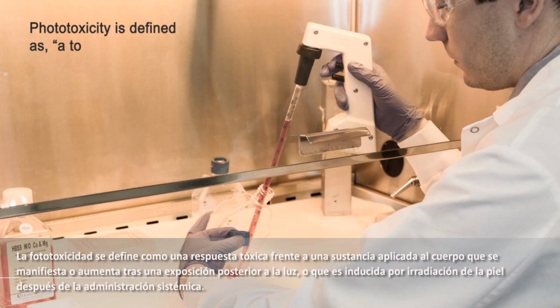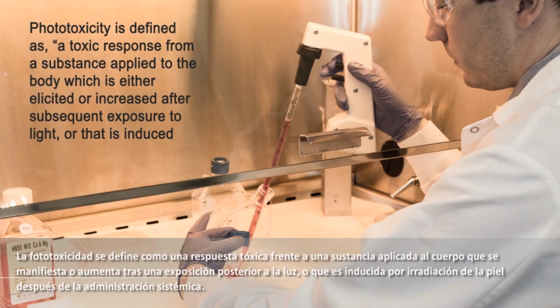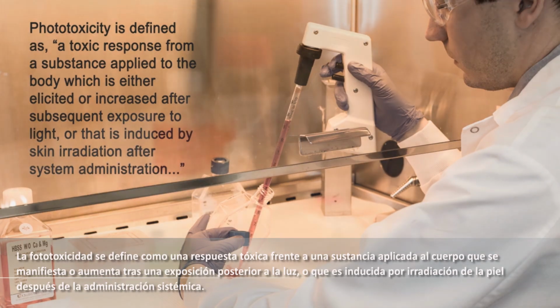Phototoxicity is defined as a toxic response from a substance applied to the body which is either elicited or increased after subsequent exposure to light, or that is induced by skin irradiation after systemic administration.